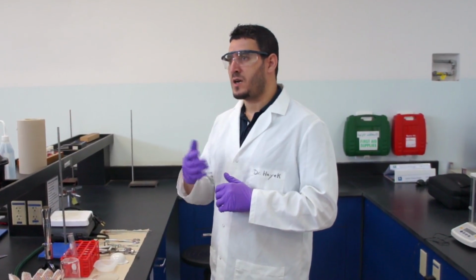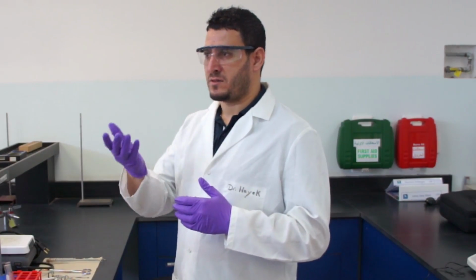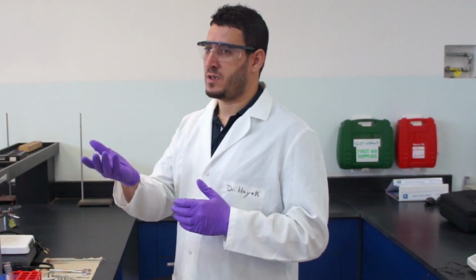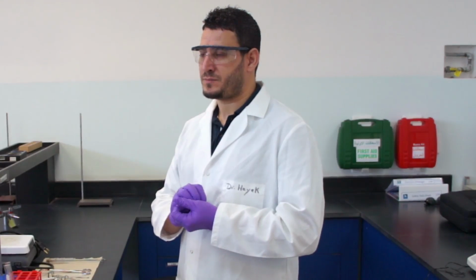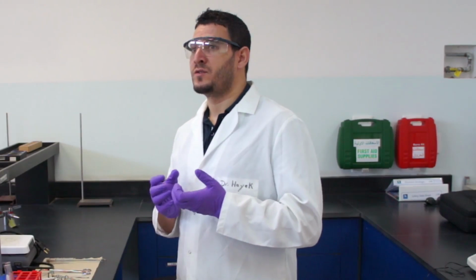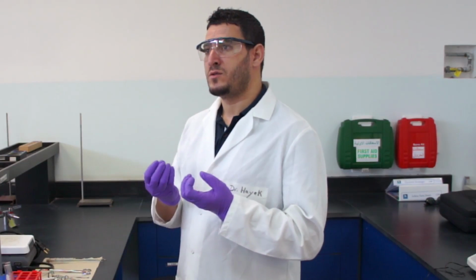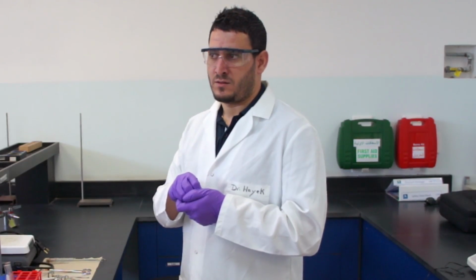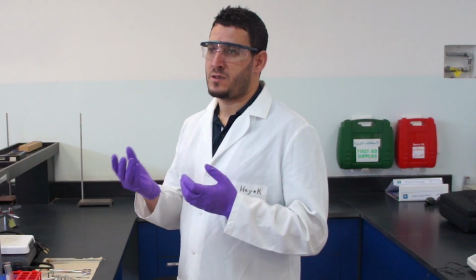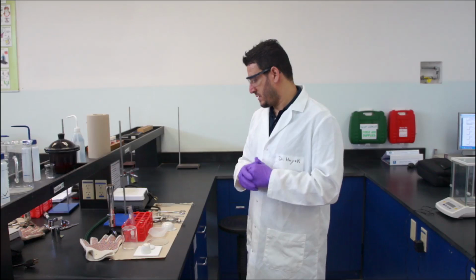Okay? It changes colors, like for example when you heat iron, it gets red. It doesn't mean that this is chemical change. It's still iron, but this is iron at very high temperature. However, change in color for the chemical change is when you mix 2 colorless solutions and you get a color. Or you mix two colored solutions, but you get a different color than the one you mixed. Okay? So things like that.